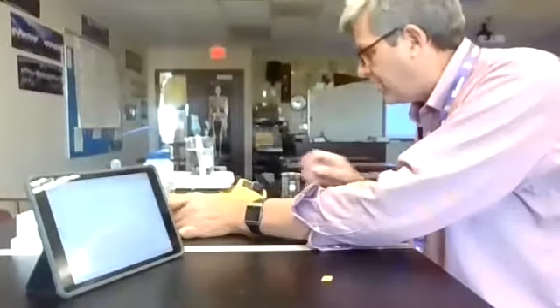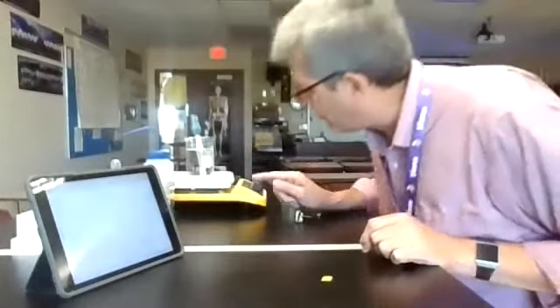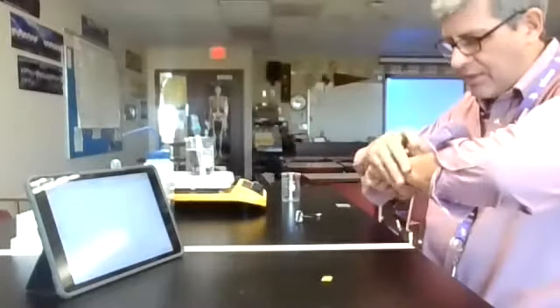One thing I had to do is click on the time-based rate sample and change it to manual stop, so it doesn't just stop after 5 or 10 seconds or whatever the case may be. So this has to run for a little bit, probably about 10 minutes or so. So we're going to let that go. I'm going to get a cold water bath ready for the second part of this little lab.